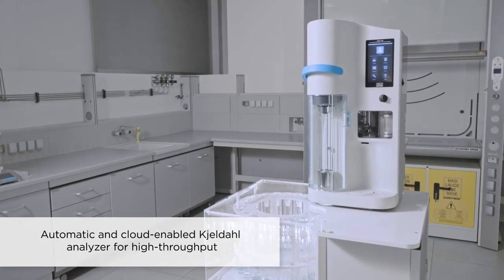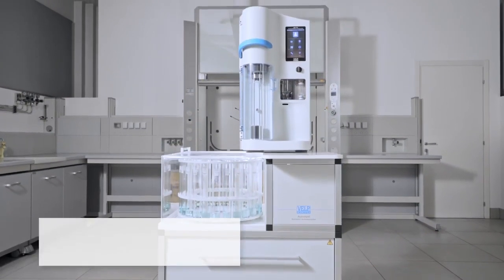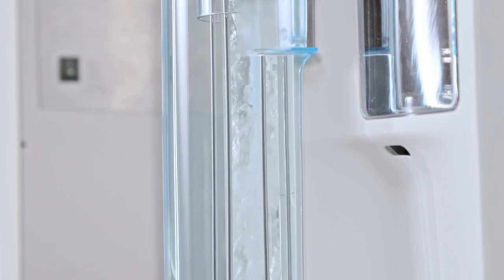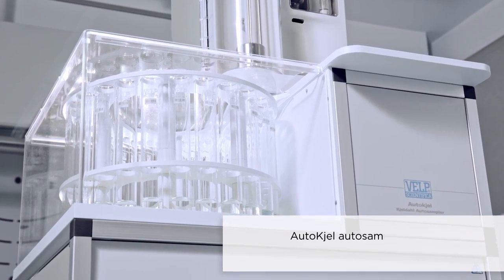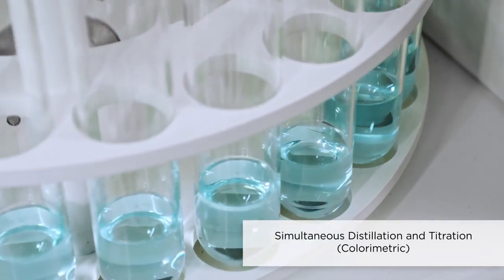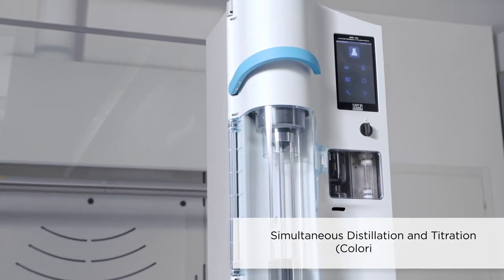UDK169 is VELP's fully automatic and cloud-enabled Kjeldahl analyzer designed for high-throughput laboratories requiring to automatize and streamline their nitrogen and protein determination processes. In combination with the Autosampler, it ensures the shortest time to results with simultaneous distillation and titration via an integrated colorimetric titrator.